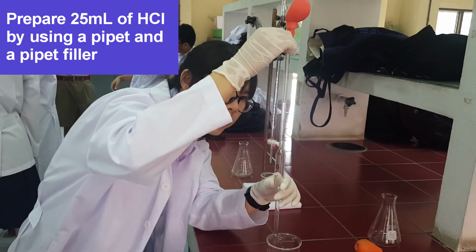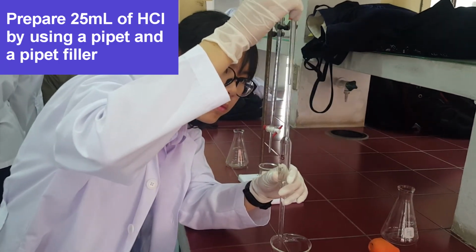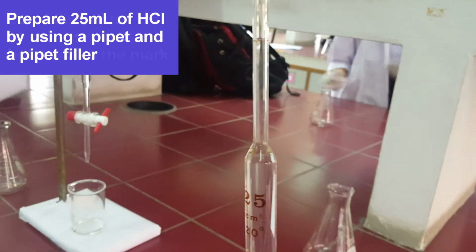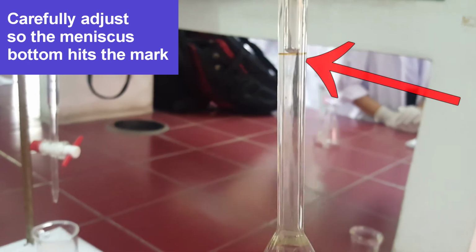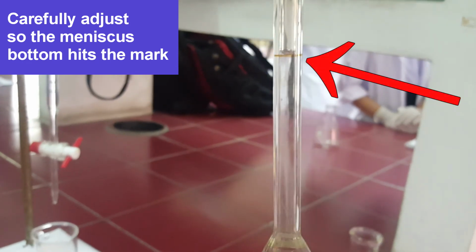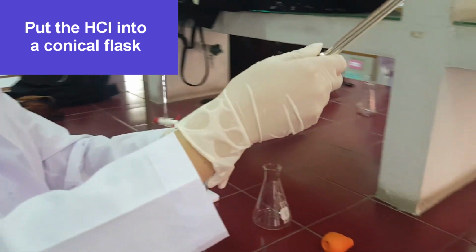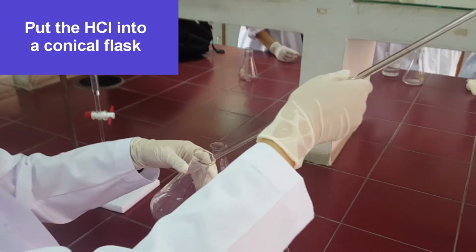Prepare 25 milliliters of hydrochloric acid by using a pipette and pipette filler. Carefully adjust so that the bottom of the meniscus hits the mark. Put the HCl into a conical flask.